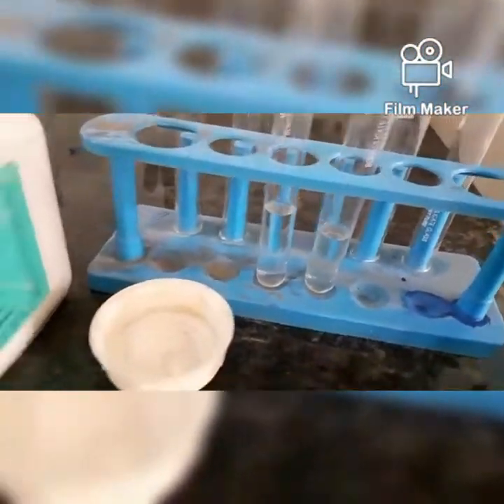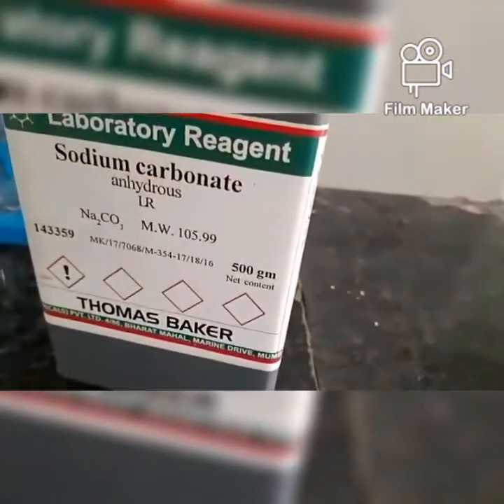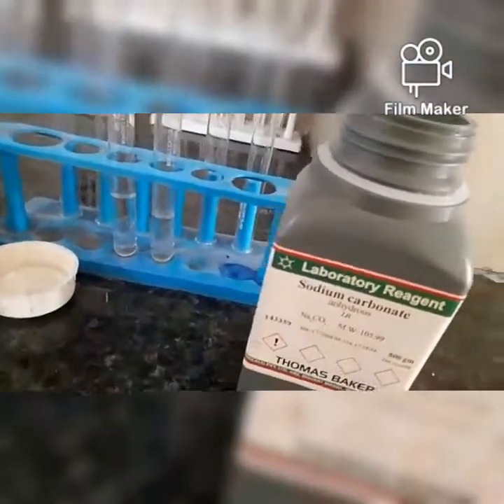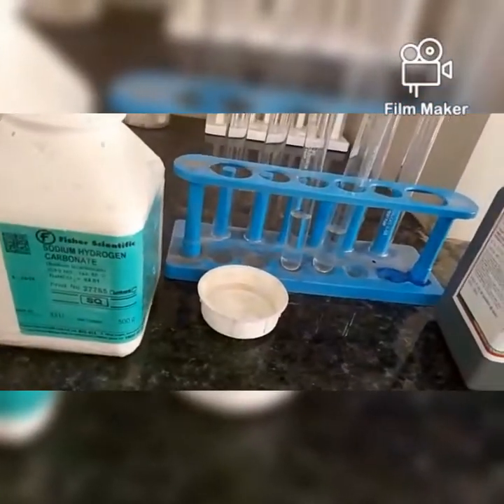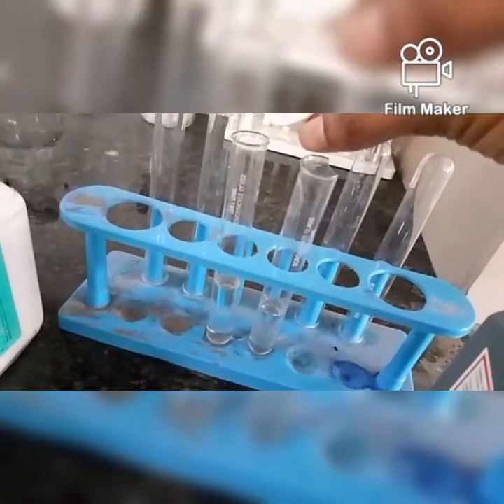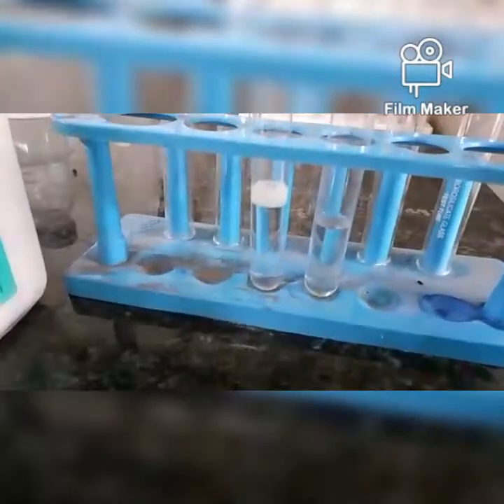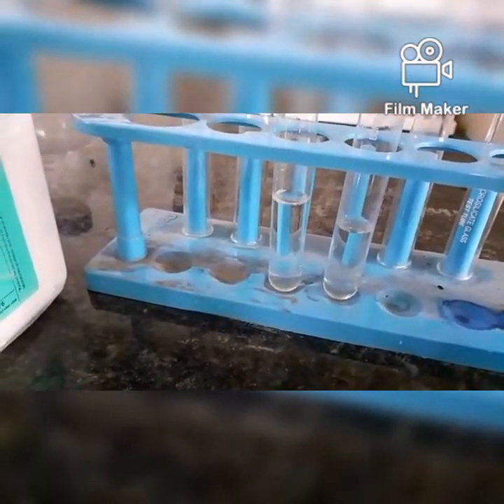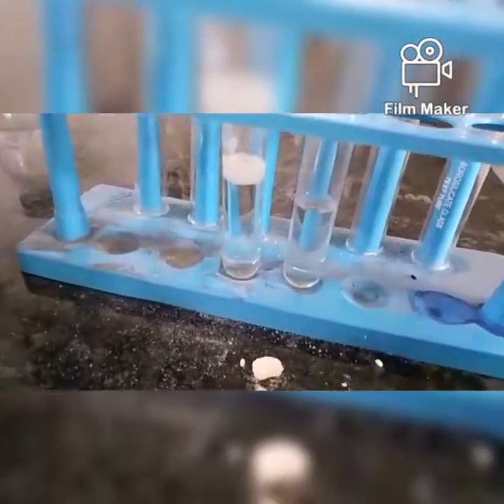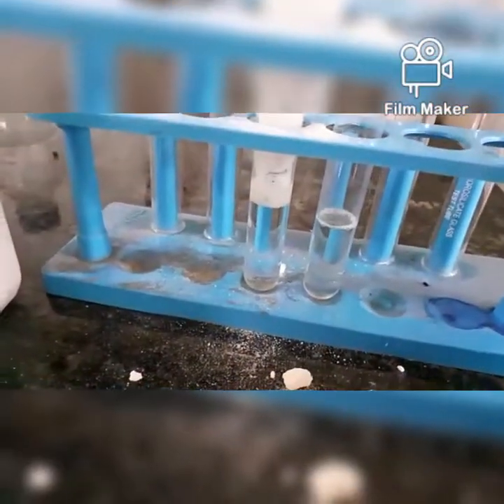Let's check how the acid reacts with sodium bicarbonate and sodium carbonate. I have taken concentrated HCl in the test tubes and now we are going to add the sodium bicarbonate first. We need to have the spatula, but I am using the cap as such. Can you see the effervescence? This bubbling is called the effervescence, right? So it shows that some reaction is taking place.